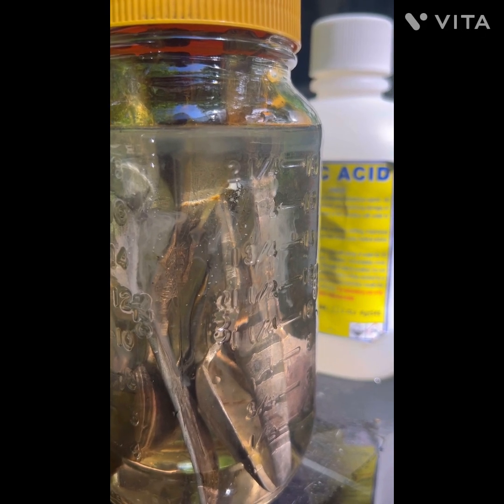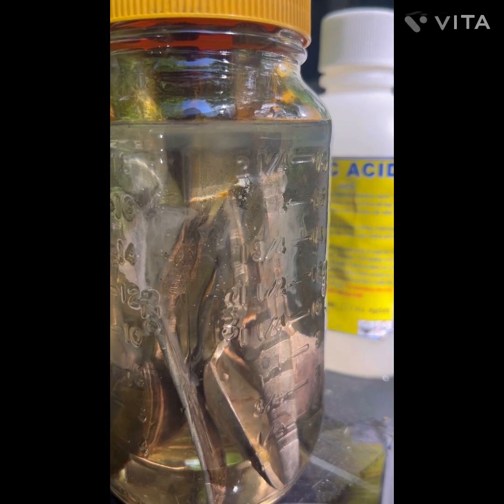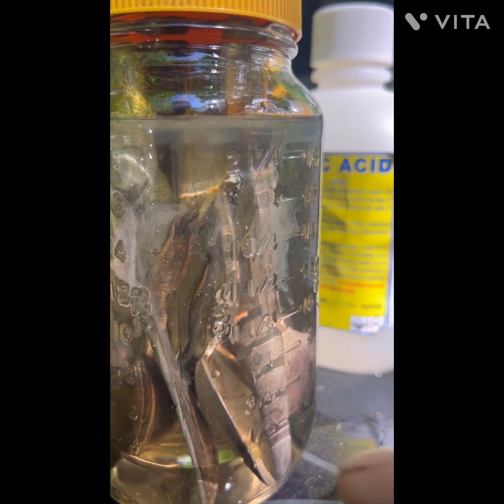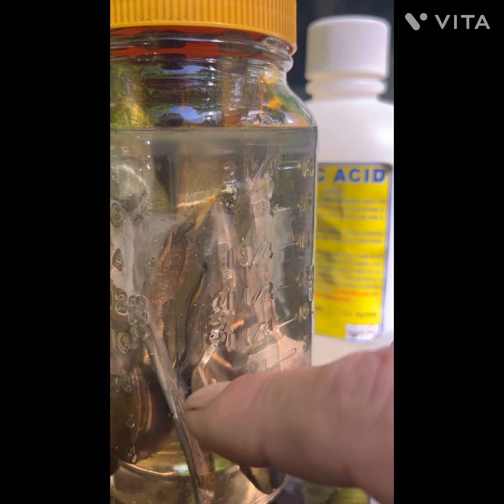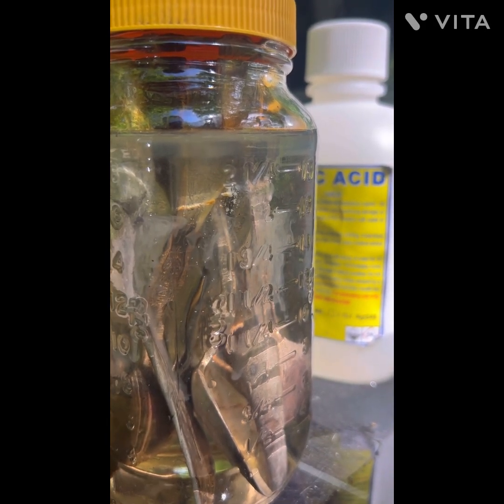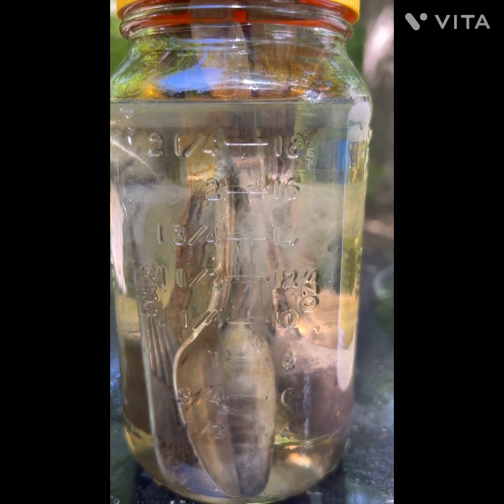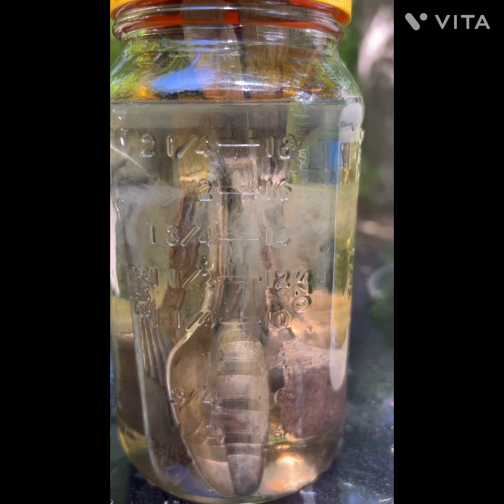You can see it's working pretty fast, so I might have to watch this a little closer. I was hoping to walk away, but since we've been talking you can see right here how much has already come off. That's the side view — the silver is really coming off fast.